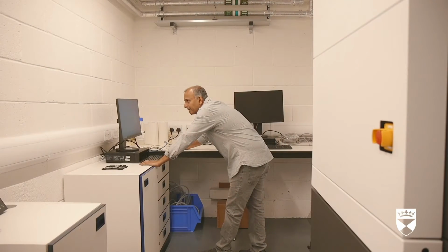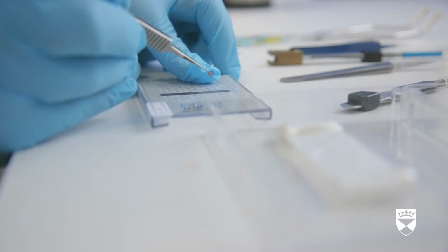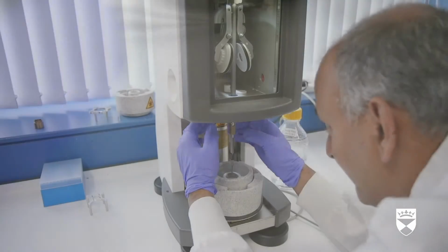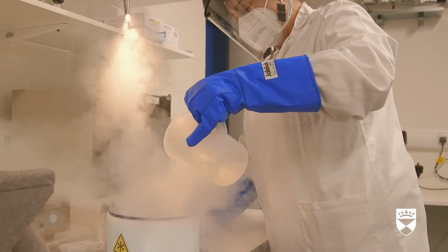The scientist picks up a small mesh grid and places it in liquid nitrogen. He pipettes liquid into a tube. To view proteins in the electron microscope, we first need to prepare a sample. We break open cells and take out the proteins we are interested in studying. We put them in a liquid called a solution, which is added onto a small mesh grid.